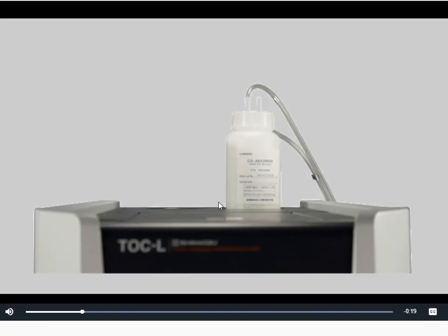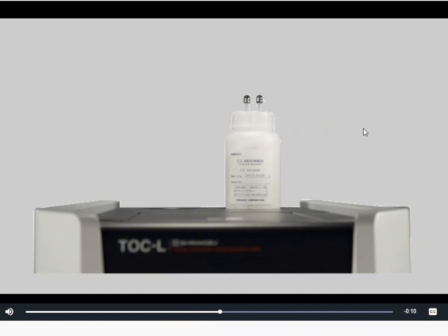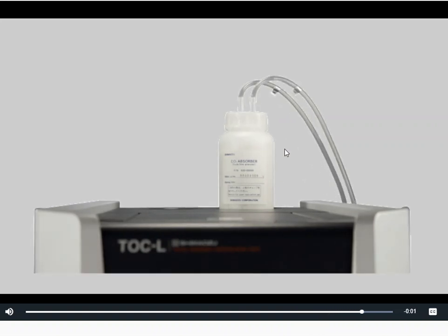So this is a video of them replacing the CO2 absorber. You're seeing them take the lines off of the top. That entire bottle with lid gets trashed. Again, very wasteful. The new one comes in, you take off the caps, and then you hook the tubing lines back up to the bottle. Again, one tubing line is coming from the detector and the other tubing line is leaving the bottle and going out of the machine. So that's why there's an entry point, if you want to think of it that way, and an exit point.